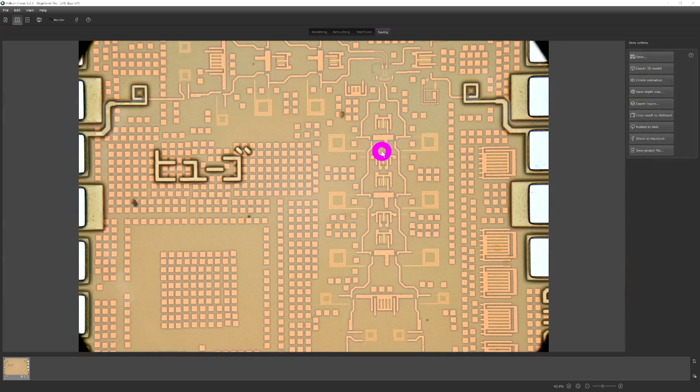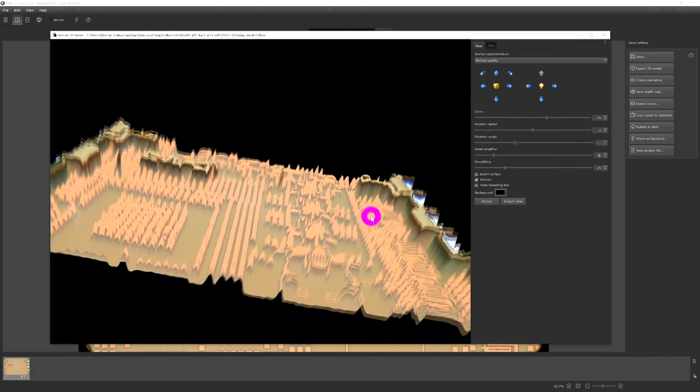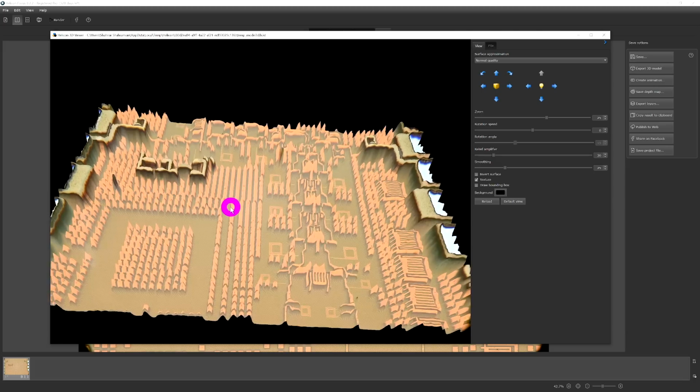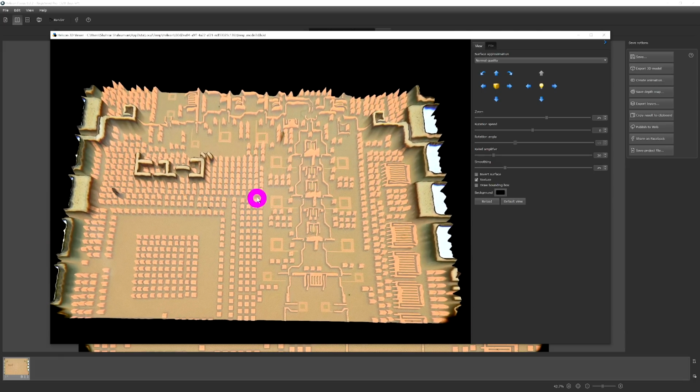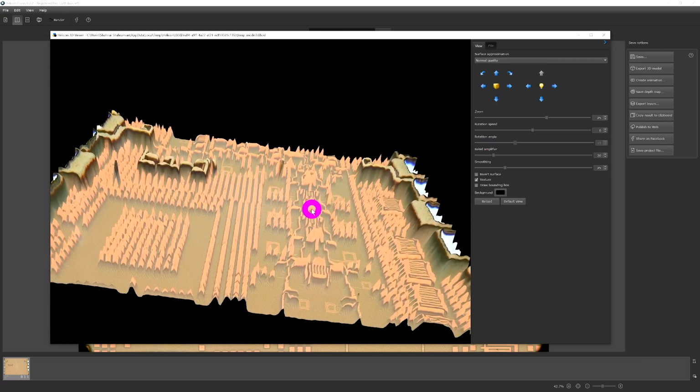If I go under saving here, I can create a 3D picture out of this. And here's the 3D image. It does a pretty good job. It figures out that the top metal layers like the pads are higher than everything else. The little individual metal fills show up as little tiny blips. The inductors, these ones are much, much lower as they are supposed to be. This is correct, of course. It's not perfect, but it works really well.